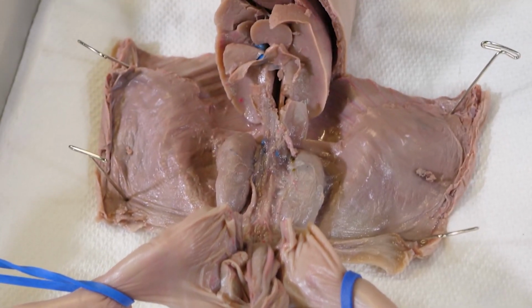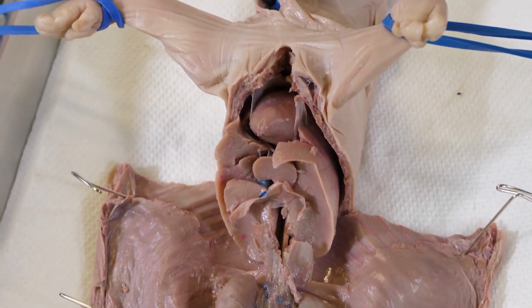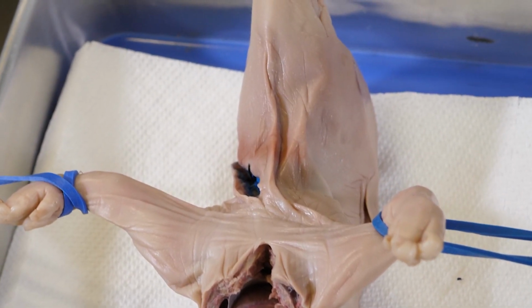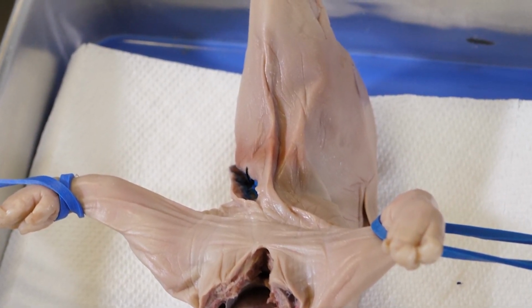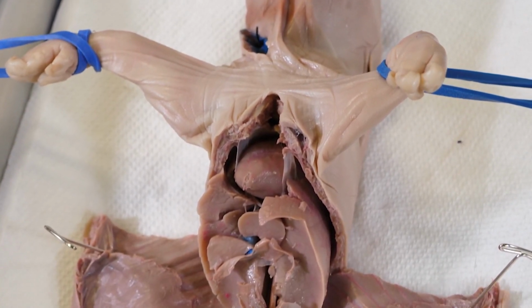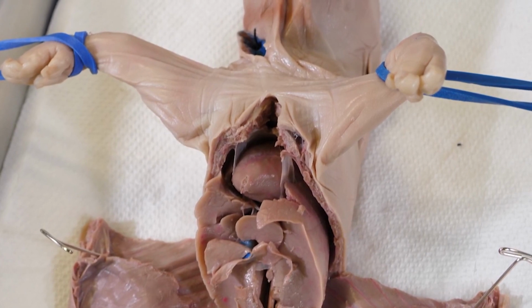In this lab, we will study its respiratory, circulatory, and nervous systems. To see the major organs of the respiratory and circulatory systems, it is necessary to open up the thoracic cavity and part of the neck. The ribs form the thoracic cage, which is designed to protect the pig's heart and lungs.